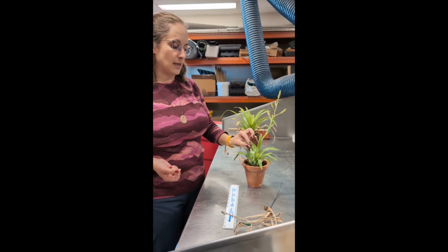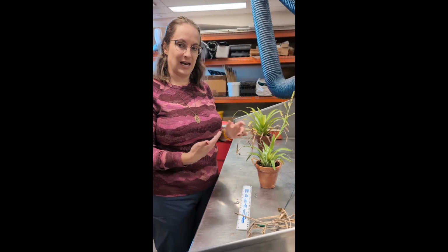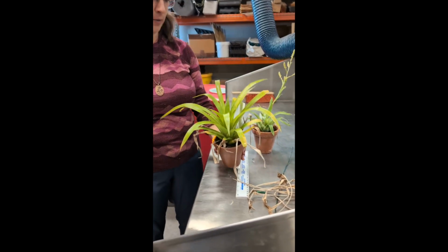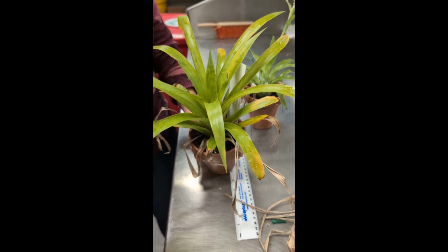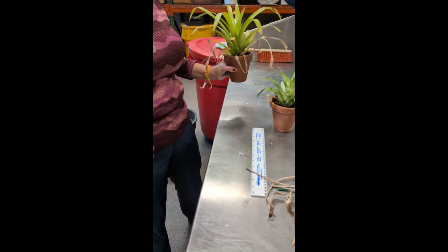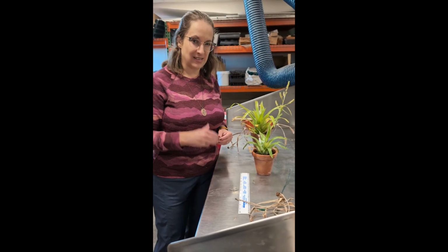So it may not make sense for me to continue to have a label on an individual leaf because the identity of what I'm counting is going to change over time. So like with this friend here, some of these younger leaves might get much bigger than some of the leaves right now that I might consider the longest, etc., etc. So you really have to kind of start from scratch each time you do these measurements, not just track the same leaves over time.